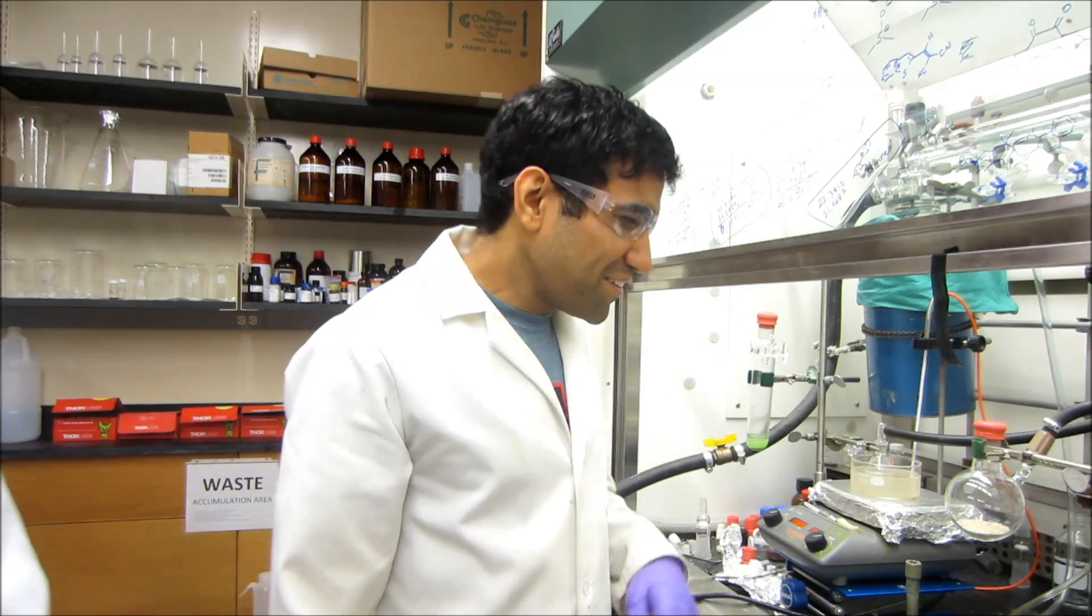All right. Today, Dr. Dan Patel is going to teach us the proper way to dry molecular sieves over which we can store or dry organic solvents. Thank you, Jason.